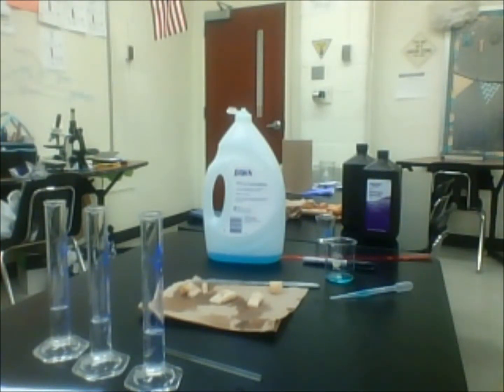So again, what I said, the hydrogen peroxide should technically break down and produce water and oxygen. So notice that it's not producing it yet. Still has not overcome that energy barrier to produce it. So we're going to use the enzyme just to speed this up a little bit. How will we know that oxygen is being produced? Again, it's going to foam up and start to bubble.